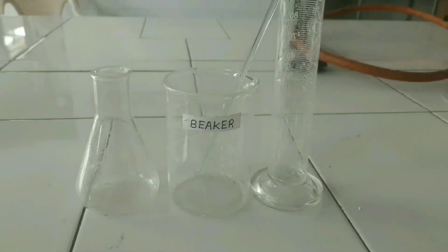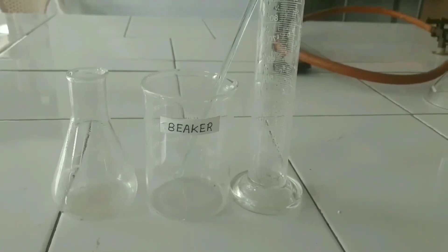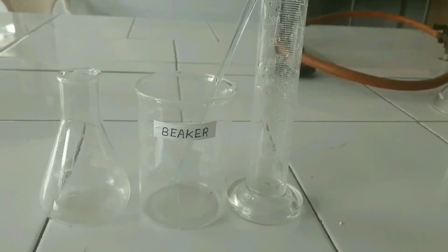Required apparatus: beaker, measuring cylinders, conical flask, and rod.